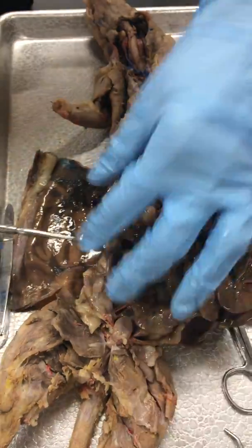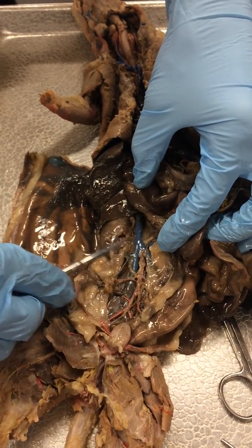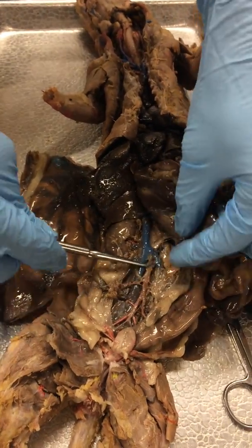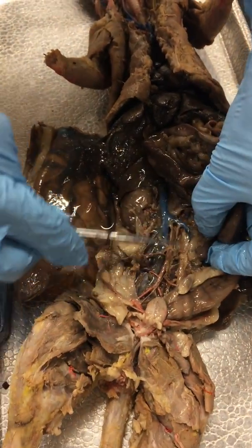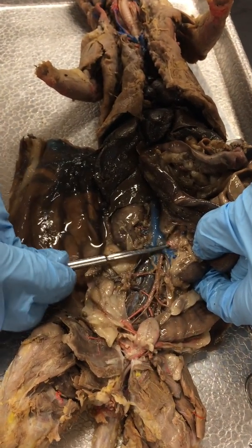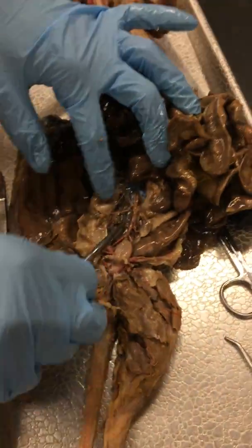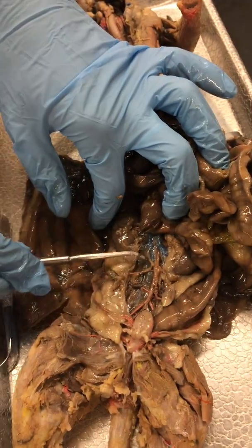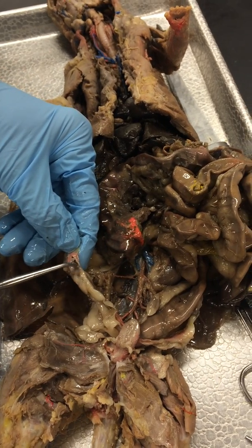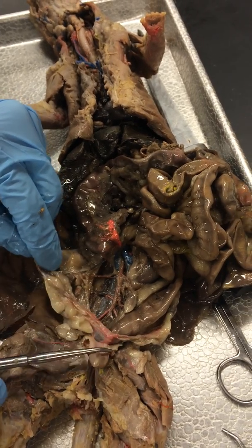And then the renal veins and arteries are attached to the kidney. So there's a renal vein right on top. Here's the renal vein for this kidney. And then the renal arteries are right underneath. So there's a renal artery. And testicular, you guys wouldn't have any, but you have an ovarian artery and the ovarian vein going over to the ovary right there and the oviduct. There's your uterine horn and uterine body.